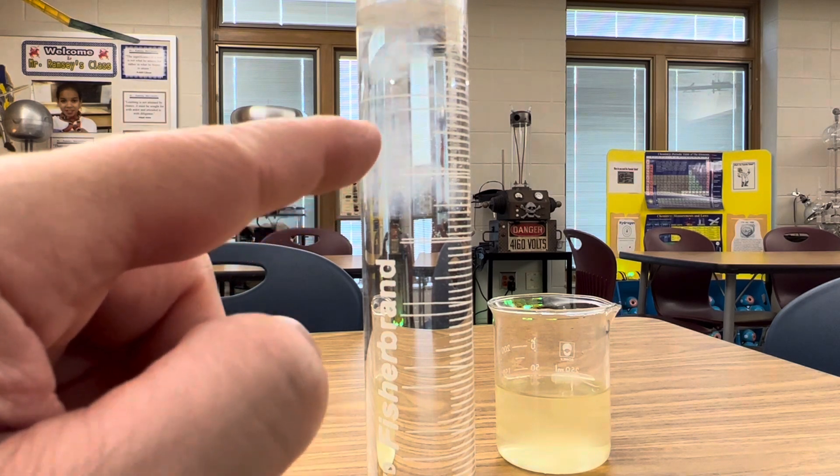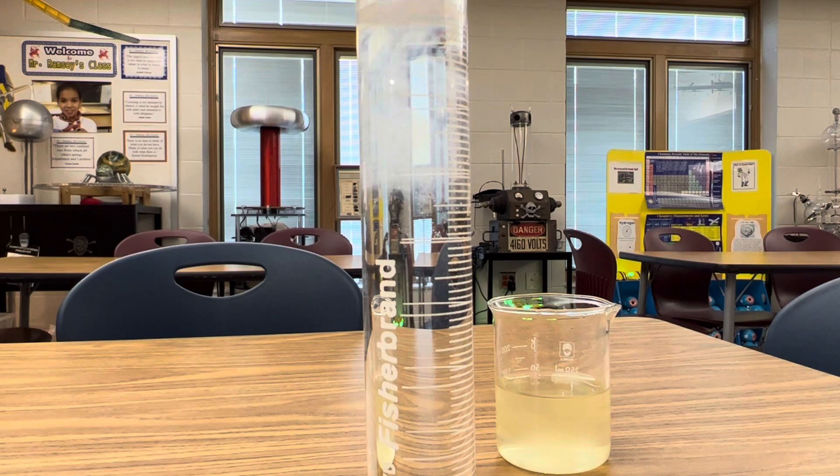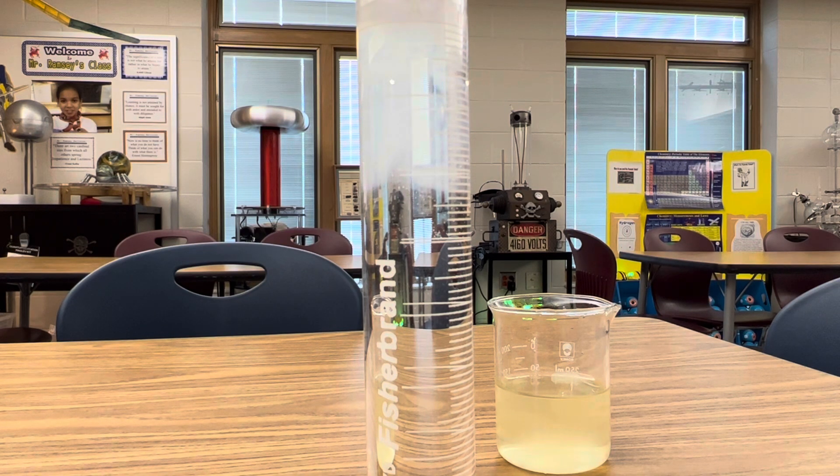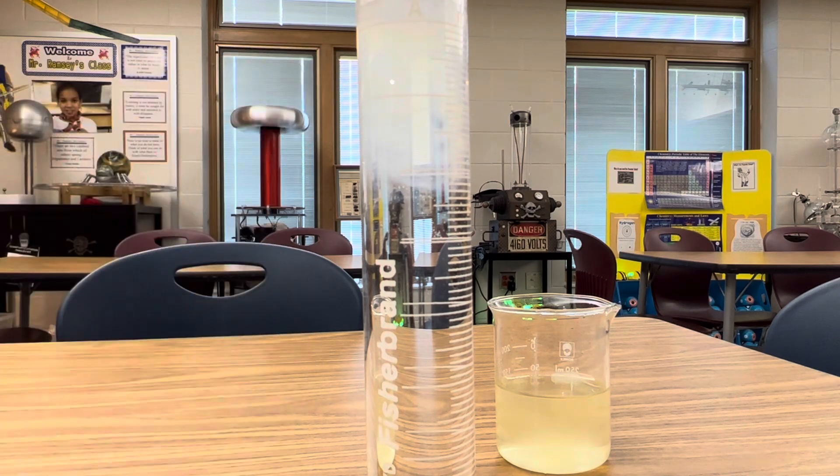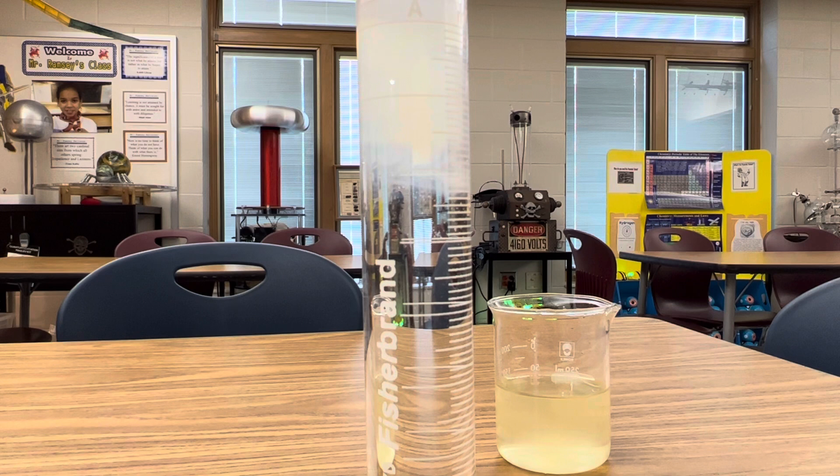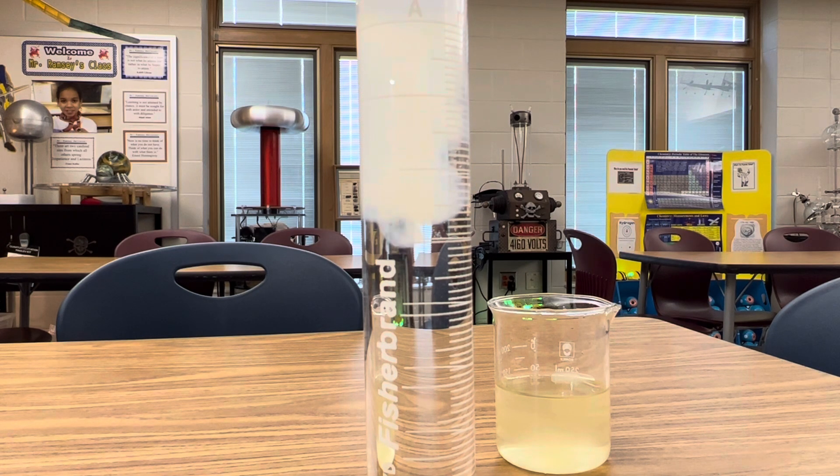Look at that. Isn't that amazing? That's zinc nitrate becoming zinc sulfide in that white precipitation that you see. Look at that. It's just awesome.